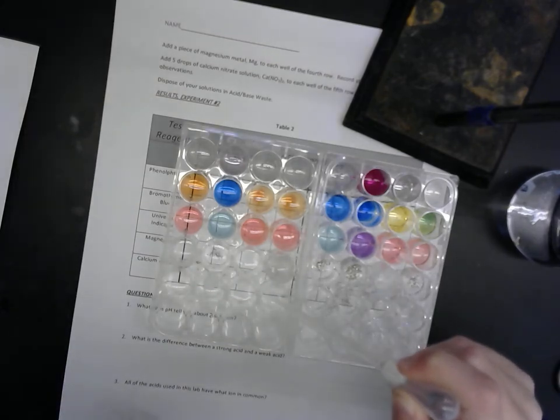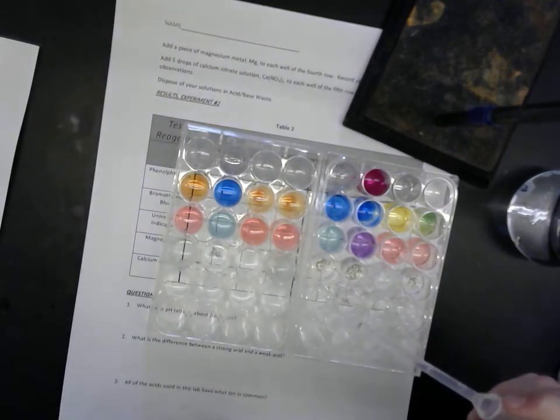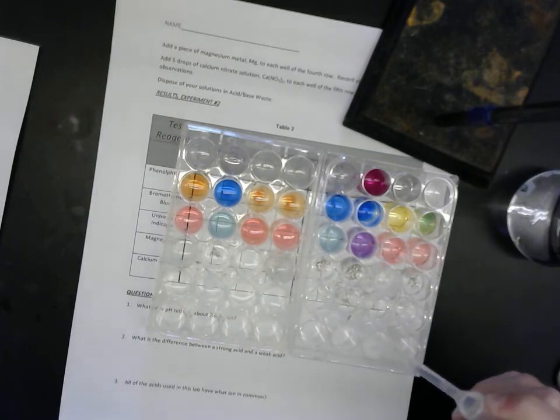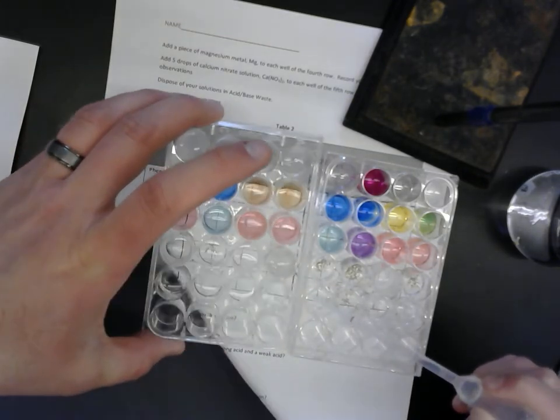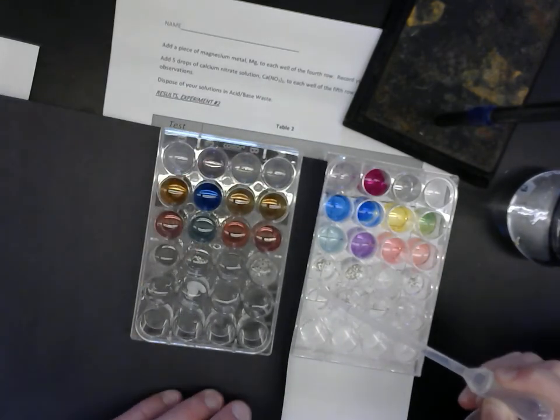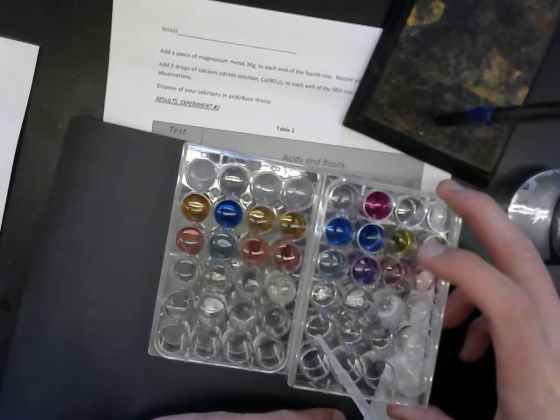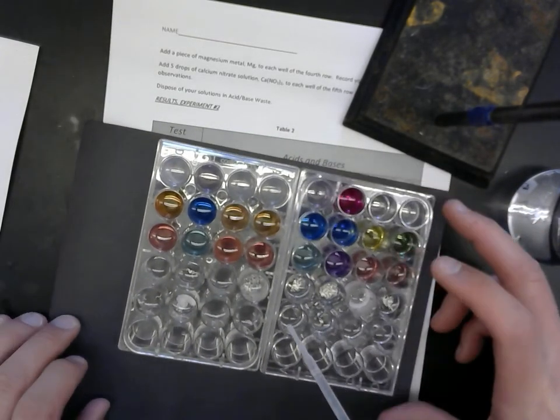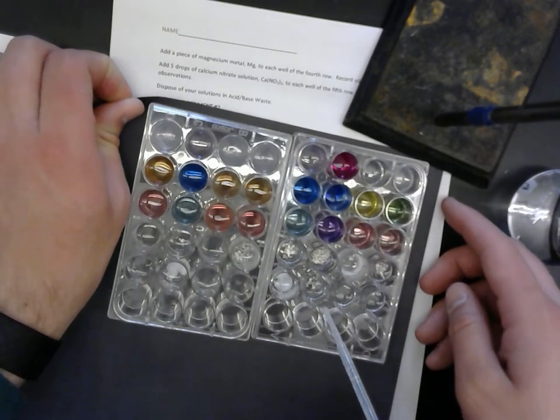Yeah, this may actually be useful. I can't remember if it. Hold on, can you back up a bit? I'm going to put a piece of black paper under there. Oh, it's cloudy too.